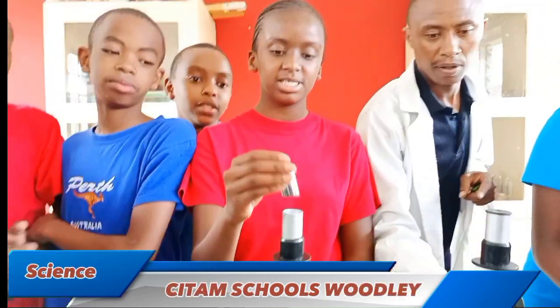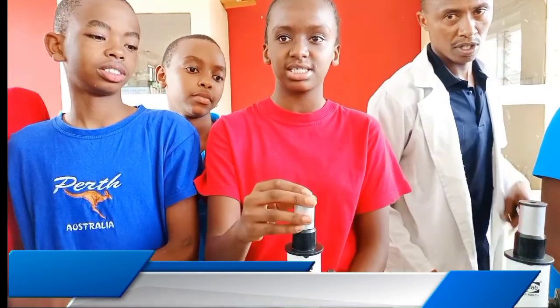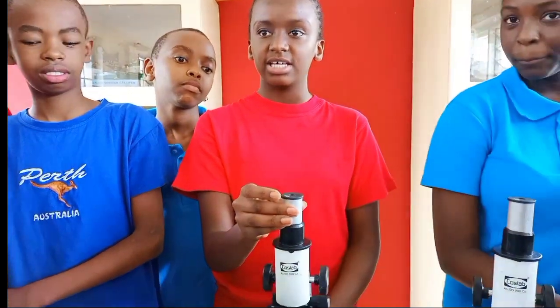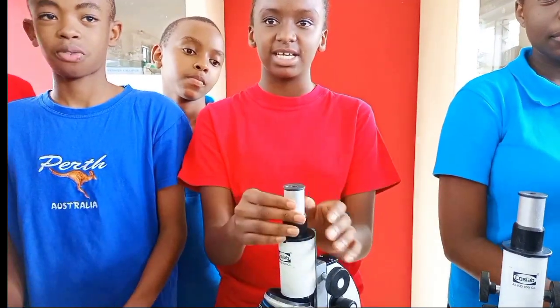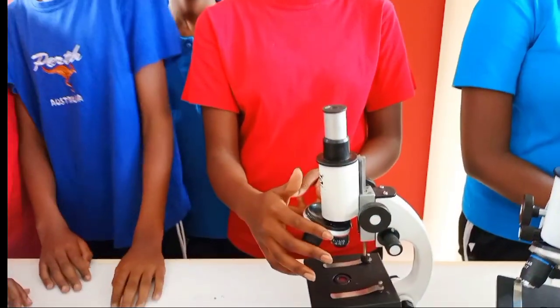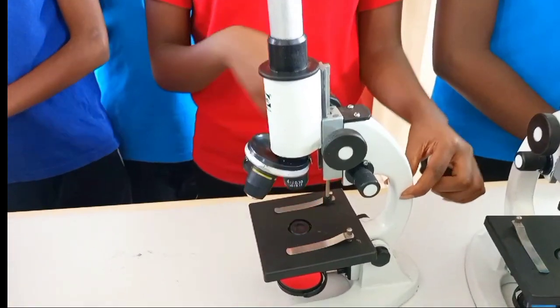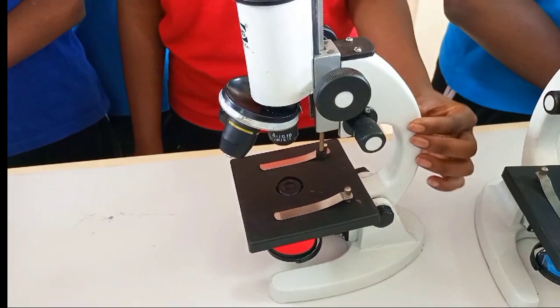This is the eyepiece. Its function is it contains lenses which magnify the image formed by the objective lens and project it to the eye. The revolving nosepiece is here. The arm supports the tube, knobs, and stage.